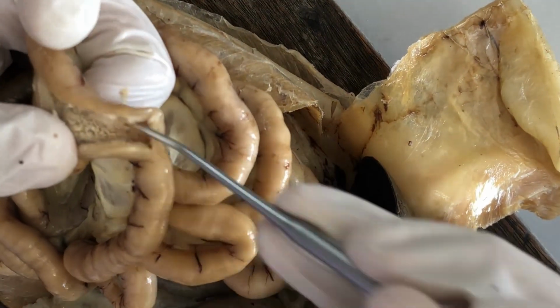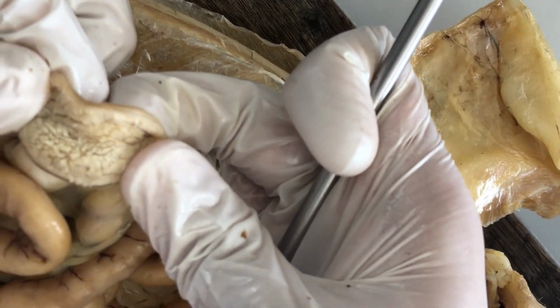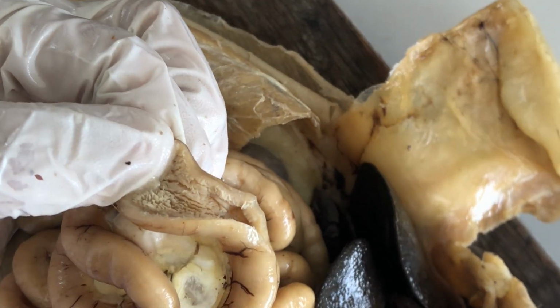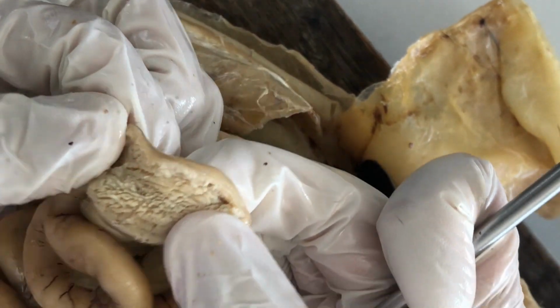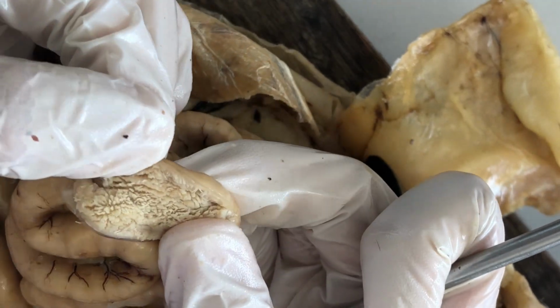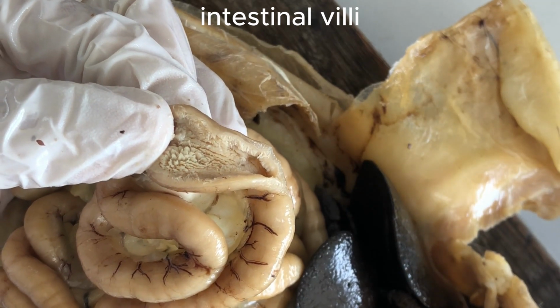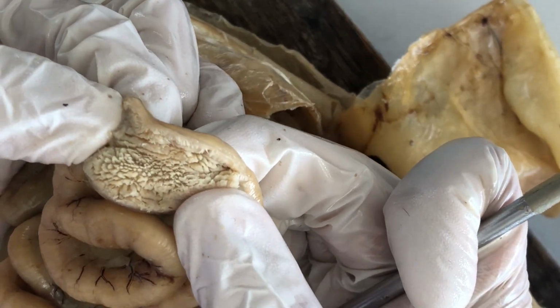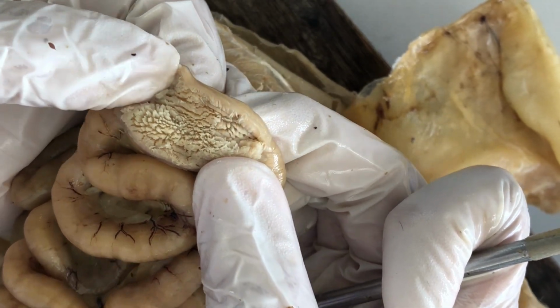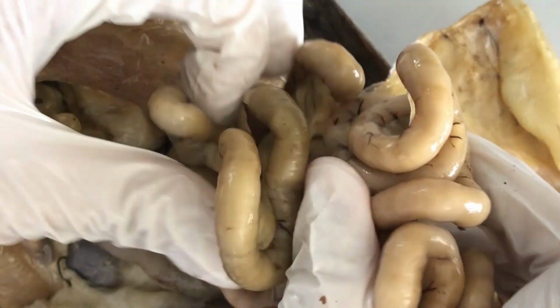So if you make a longitudinal incision on one of the segments of the intestine, you'll see that its internal wall, the mucosa, is not smooth. It has a velvety appearance, kind of like velvet, and that's because of the numerous villi, which are infoldings of the mucosal wall of the intestine. And those villi will essentially increase the surface area for nutrient absorption, because the intestine is specialized for that function.